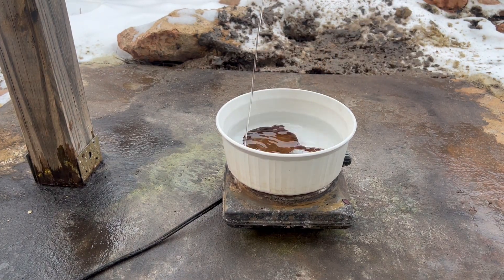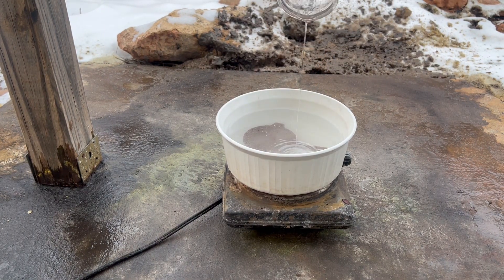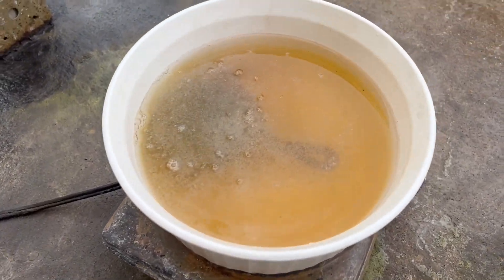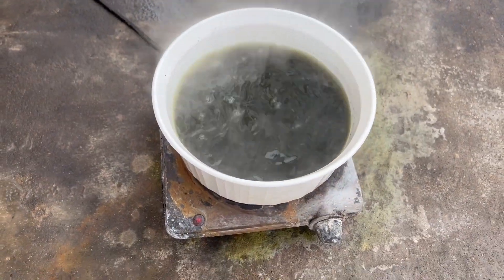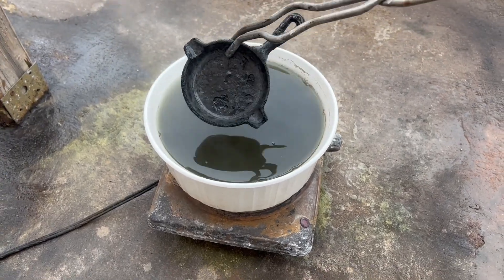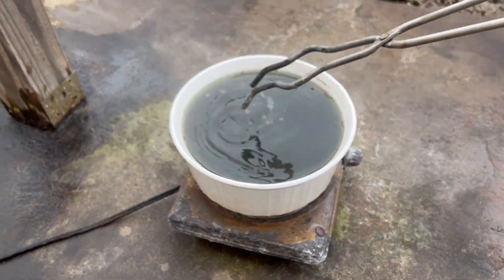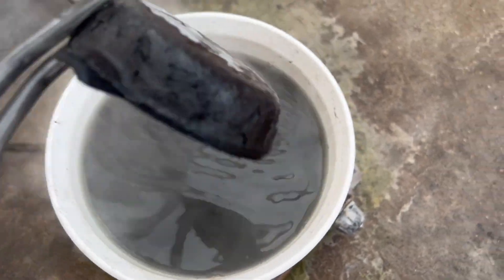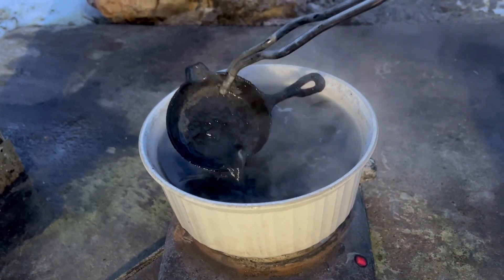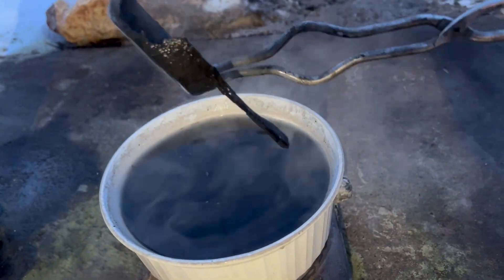This is a ceramic dish of water with the cast iron pan on my beat-up hot plate, which I'm adding the sulfuric acid to. It generates some heat but doesn't do much initially. The rust forms a sort of protective layer, but once the solution is hot enough it'll dissolve and expose the fresh cast iron. The reaction mixture quickly turns dark green because that's how ferrous sulfate behaves in aqueous media, forming the green aqua complex.